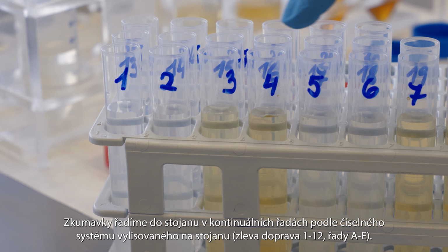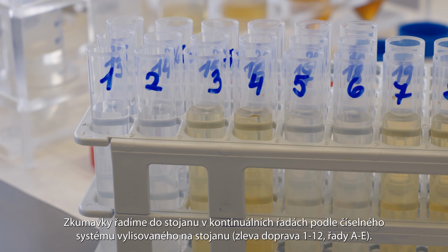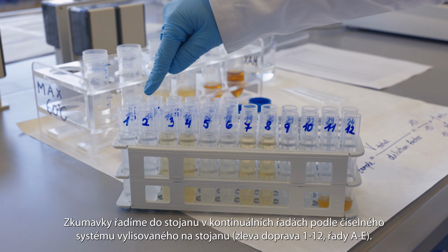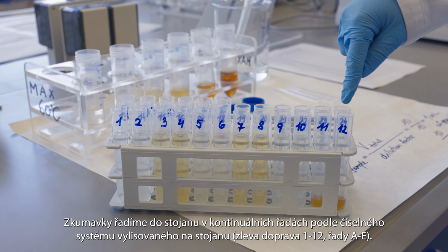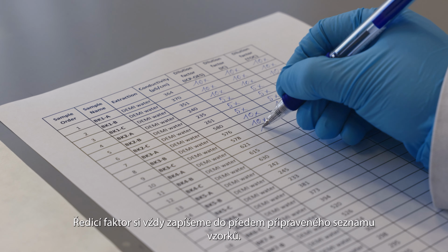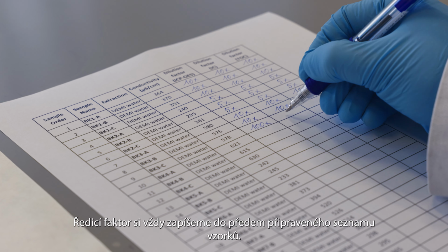Place the tubes in the rack in continuous rows according to the numbering system printed on the rack, from left to right 1 to 12, rows A to E. Always write down the dilution factor in a pre-prepared sample list.